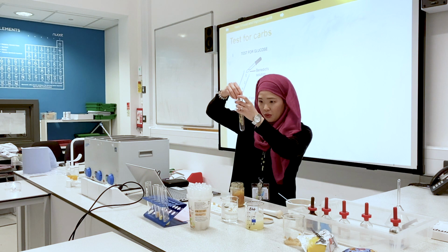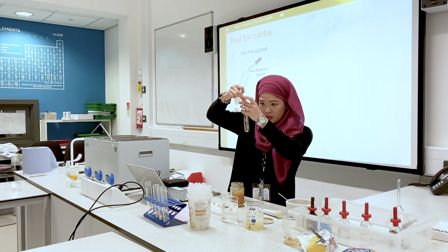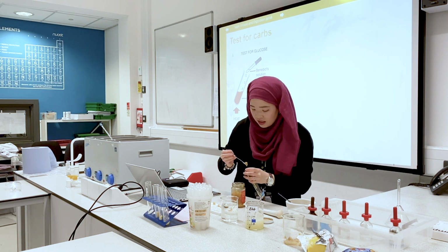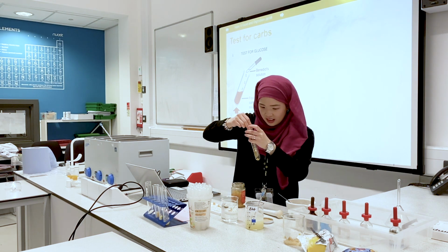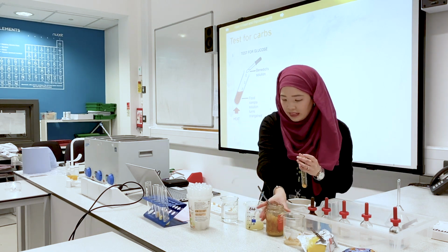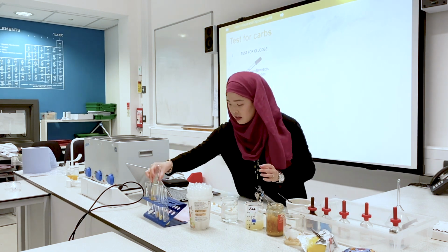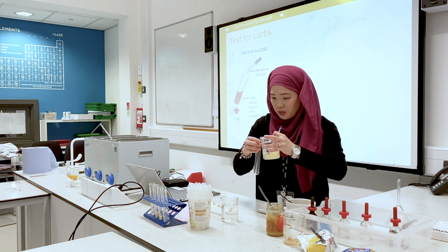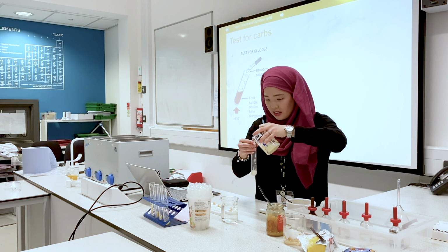Try and get it at the bottom of the test tube. And egg, which I'm going to pour in.